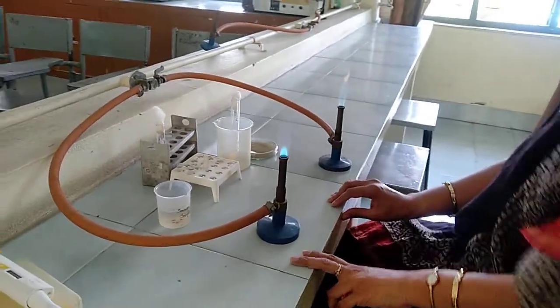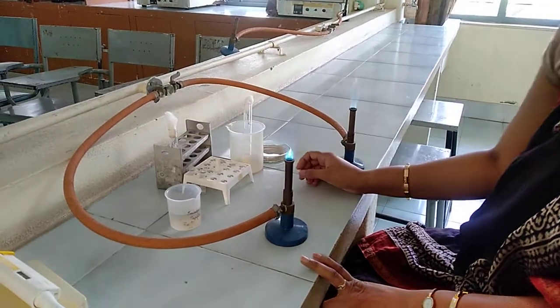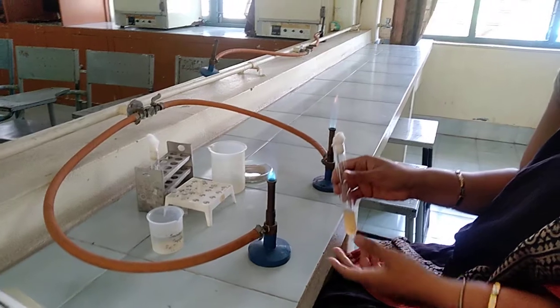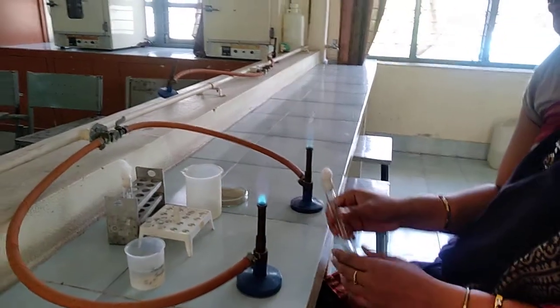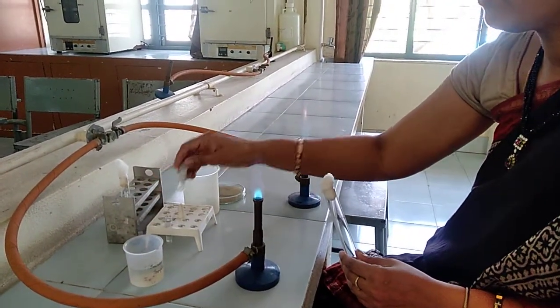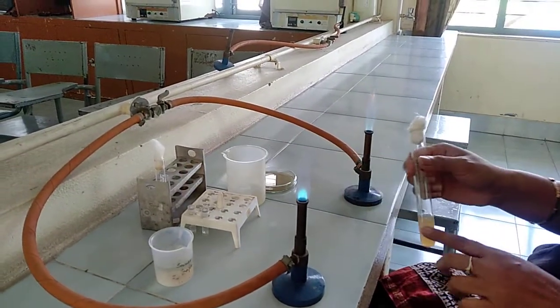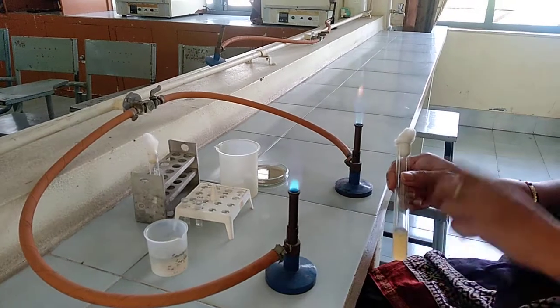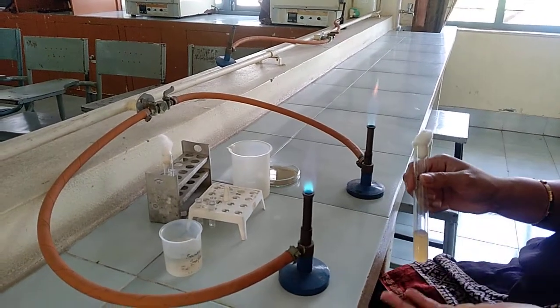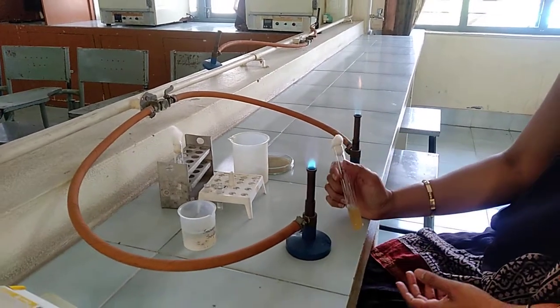Let us see how to go with the procedure. Whenever we are incubating the E. coli culture, I had added the MgSO4 and maltose — 50 microlitres have been added to the 5 ml LB broth along with the E. coli culture. This needs to be done prior to the experiment, one day before, and we need to incubate the culture.